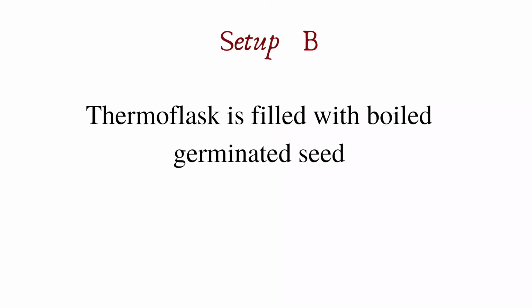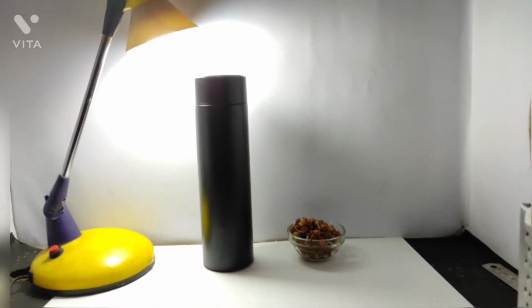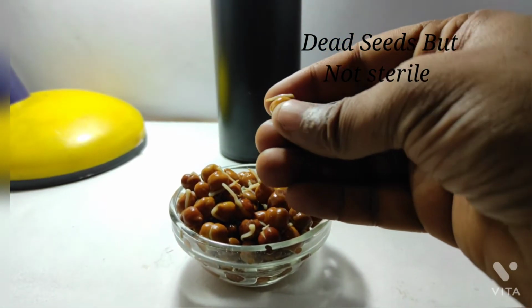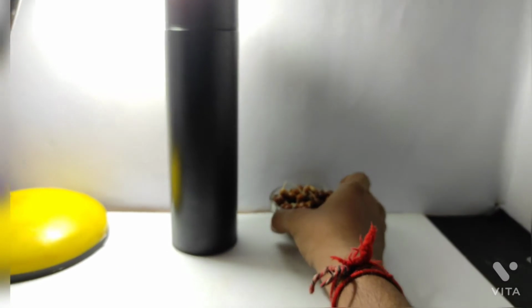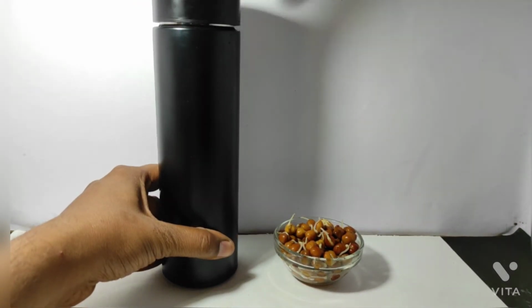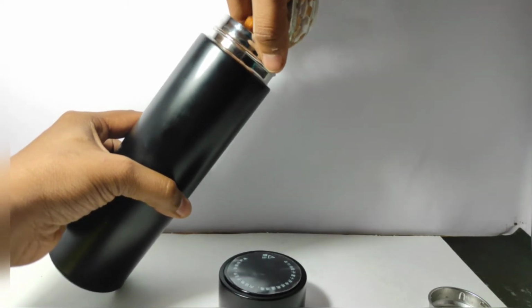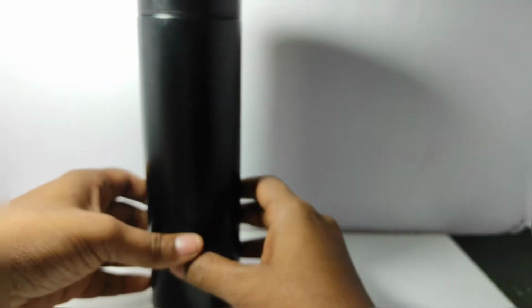In setup B, we have a thermoflask which is filled with boiled germinated seeds. In setup B, we need a vacuum flask along with a few boiled germinated seeds. That means we have killed the seeds by boiling them in hot water. Now fill the second setup with boiled germinated seeds, keep it undisturbed and observe for the rise in temperature for the next 3 days. Now note down the initial temperature.